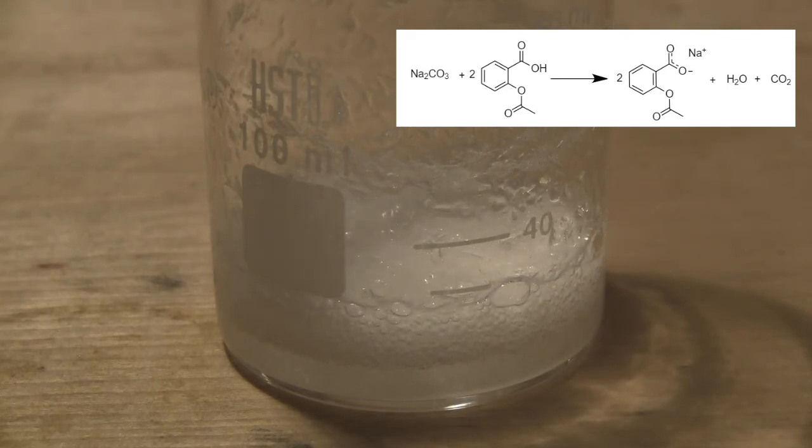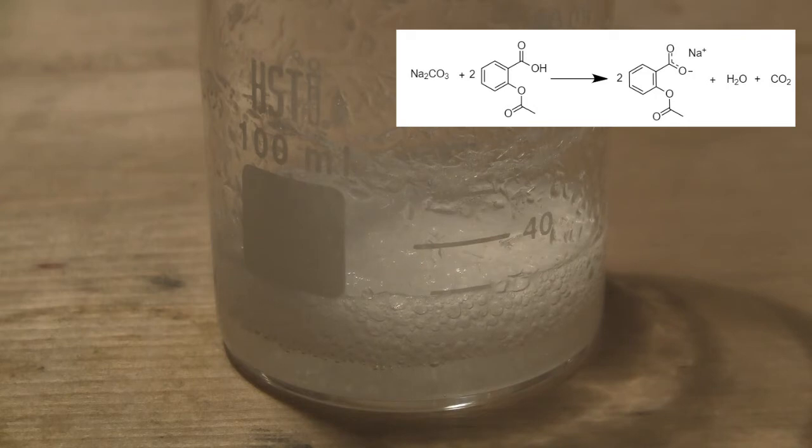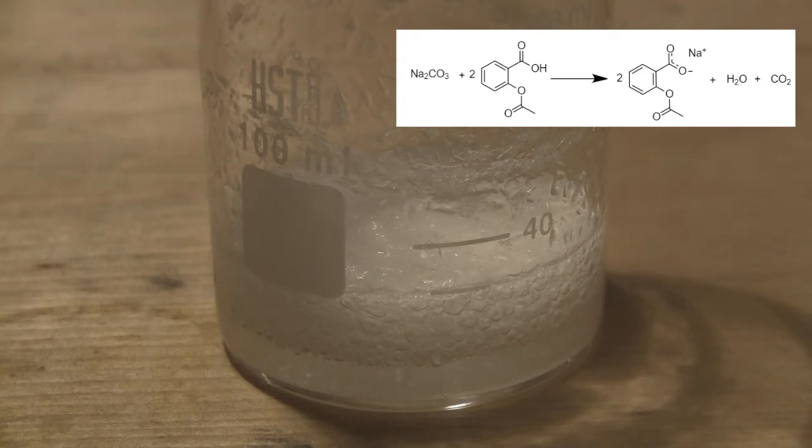and water as byproducts. Sodium hydroxide cannot be used here, as it will also hydrolyze that acetyl group, making salicylic acid. This will take some time as the reaction is a bit slow, but you'll be able to tell when the reaction is done when no more CO2 is being bubbled off.